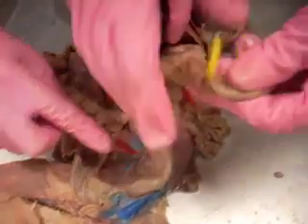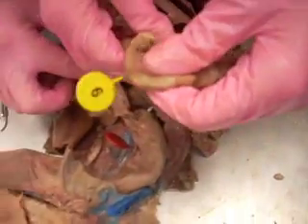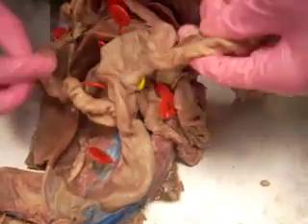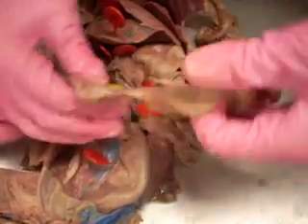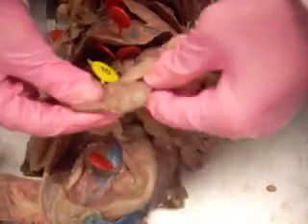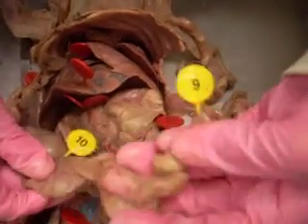Down here, it's all convoluted. You would see the jejunum, number 9, and it leads into — you can see the drastic difference. What was number 9? Ileum — the ileum, number 9.